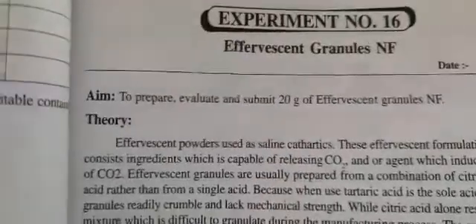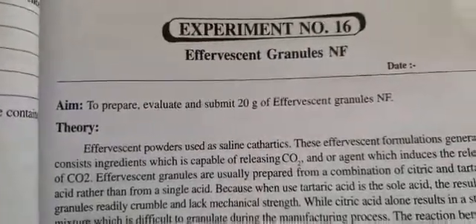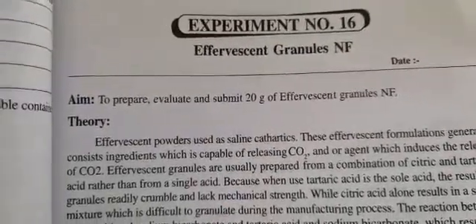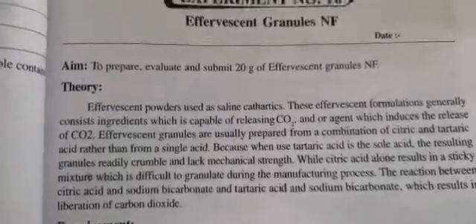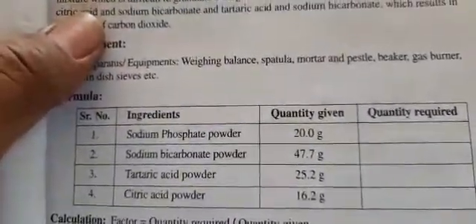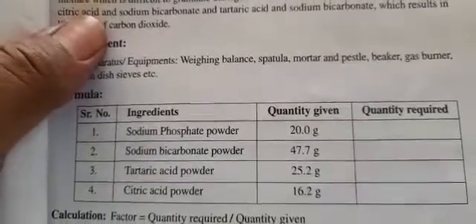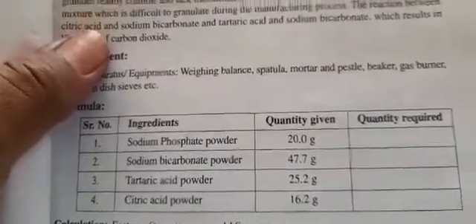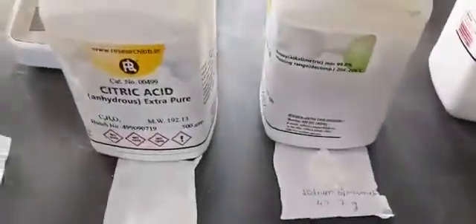Good morning students. Today you are going to prepare, evaluate, and submit 20 grams of effervescent granules as per the National Formulary. The ingredients are sodium phosphate powder, sodium bicarbonate powder, tartaric acid powder, and citric acid powder. The quantities have already been noted.